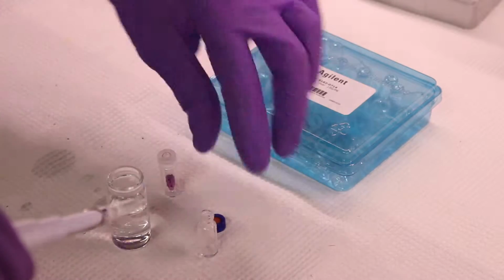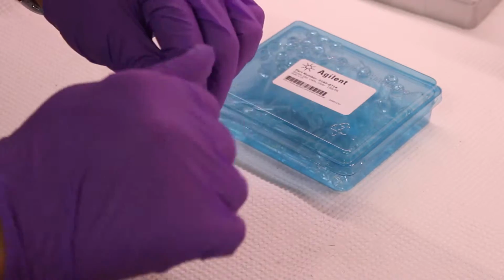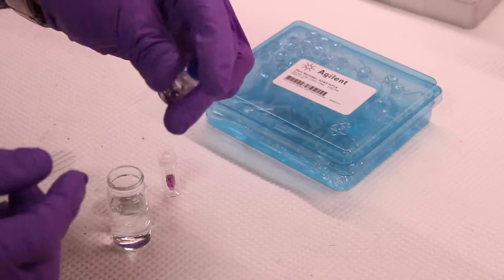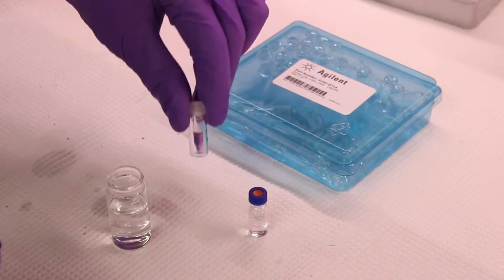Your sample should be prepared in your lab in a septum top vial, such as this. Several different kinds of vials are available, and some have conical bottoms which are suitable for smaller volumes of material. The concentration you need depends on which analytical method you're going to use on the instrument, but typically the concentration needs to be somewhere between micromolar to millimolar.